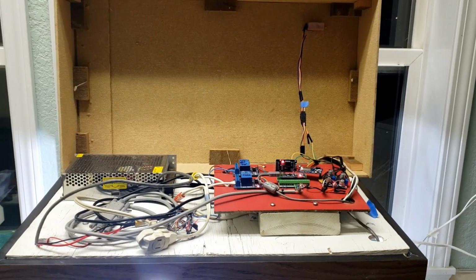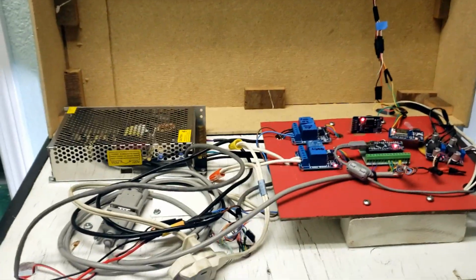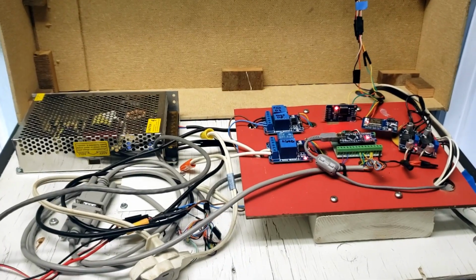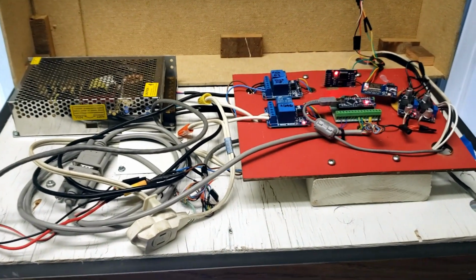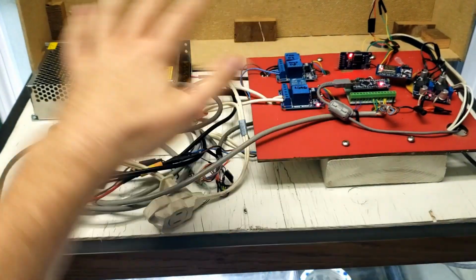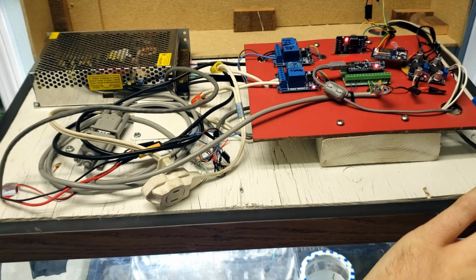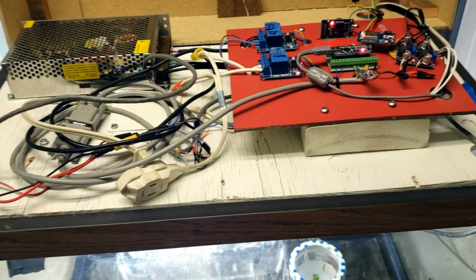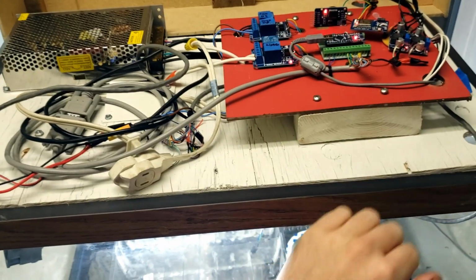Okay, here is the brains behind everything. This is what's making everything actually tick. I will start off with the most basic components and then I will get into the details of what's going on up here. Before I get in too deep, I want to mention all of these components are modular, so I can take this whole unit off and put that into a different box or maybe a greenhouse or really anything I want to control without having to rewire all the sensitive stuff.